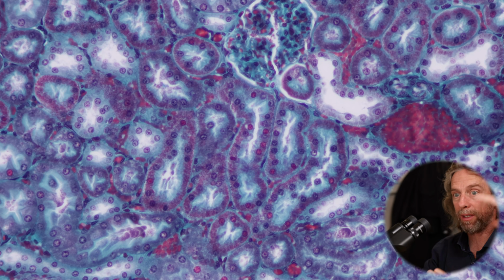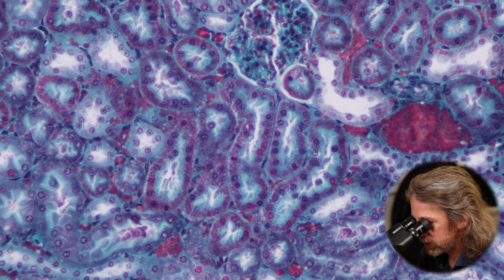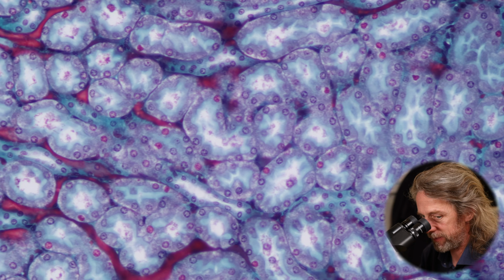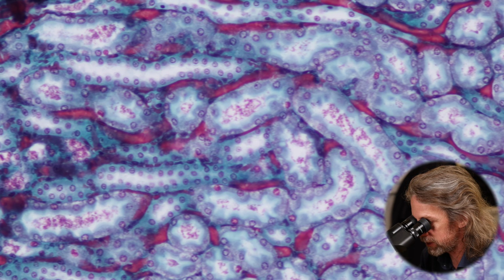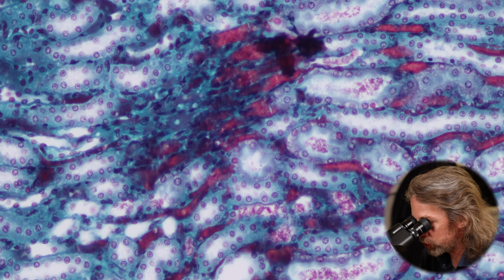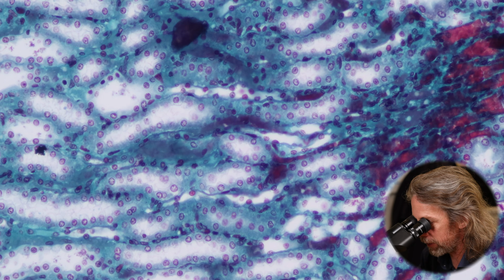So imagine the cortex, you've got your renal corpuscle, you've got the tubule starts, and then it descends off down towards the medulla, doesn't it? So if we slide slowly towards the medulla, look at that blood, look at those tubules, and now as we're sliding towards the medulla, we're starting to see tubules running in that direction towards the tip of this lobe of the kidney, of this pyramid, right?